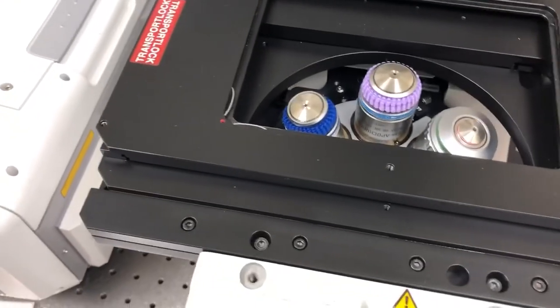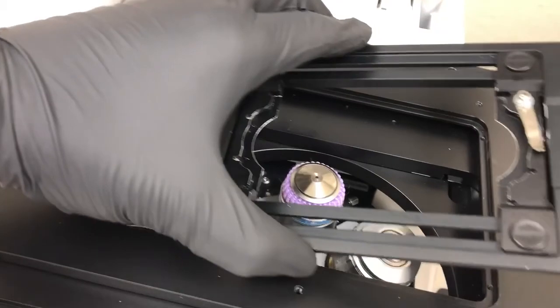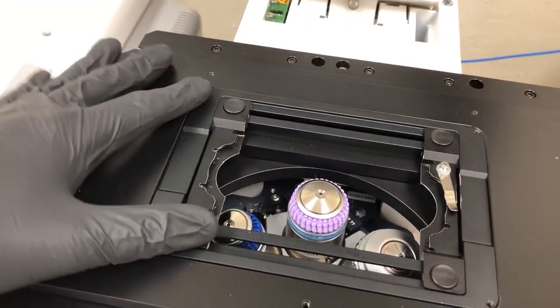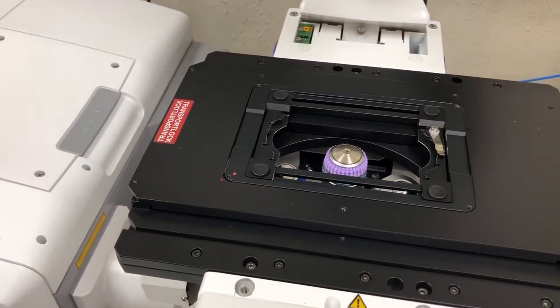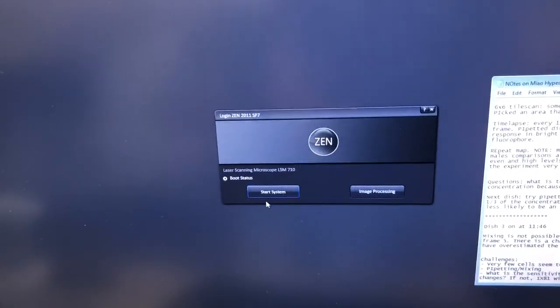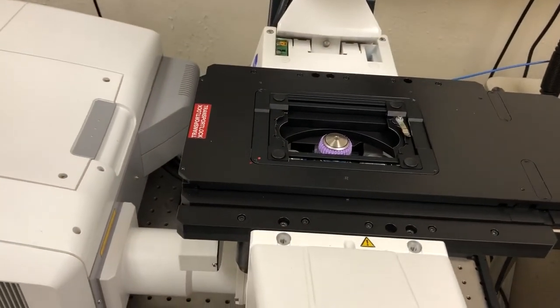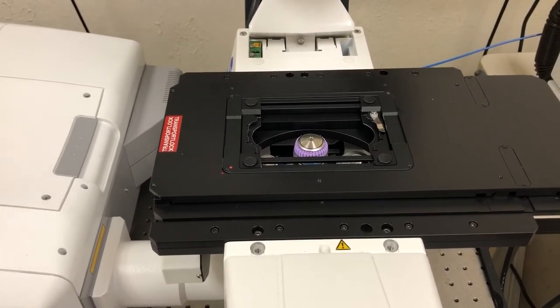See there? So what remains is to clean that objective, and then once we've cleaned it, to put on this for the next person. So I'll do the cleaning off camera, but once you've done that, it's ready for the next person. I'm just going to tell Zen to start system. And when the next person comes in, which is going to be in about half an hour today, they'll have everything ready for imaging. If you have any questions, please let me know.